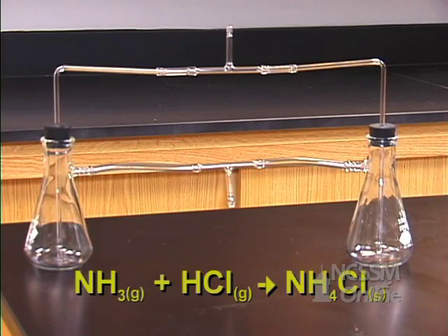It will produce ammonium chloride, which is a solid, which we'll see as smoke coming out of the tube.